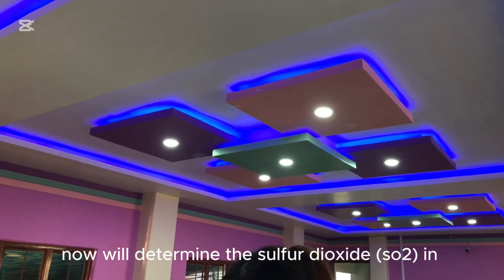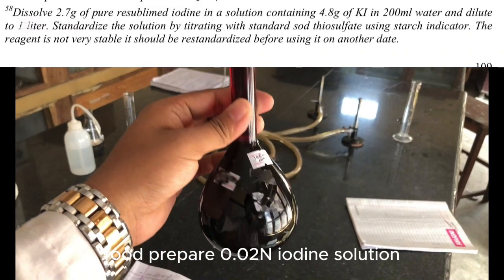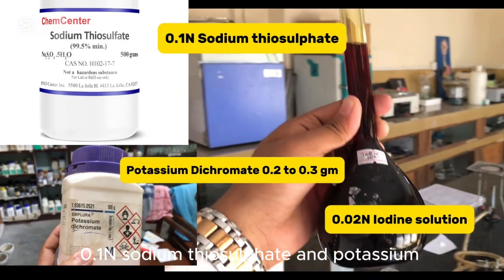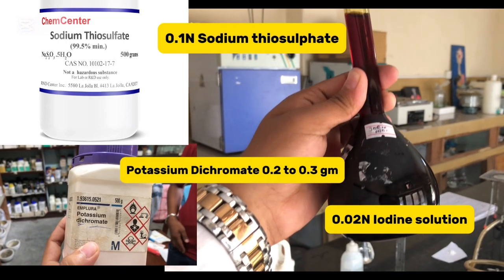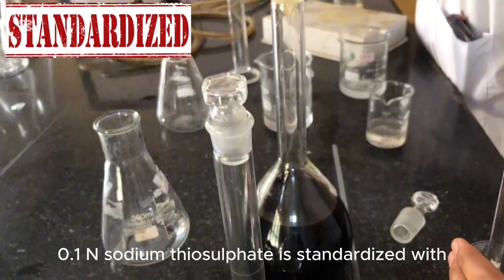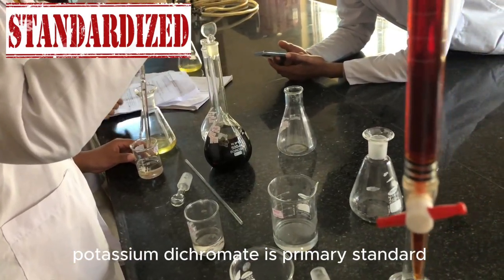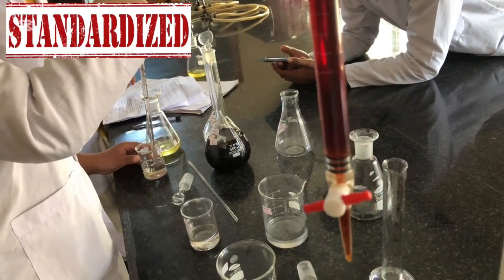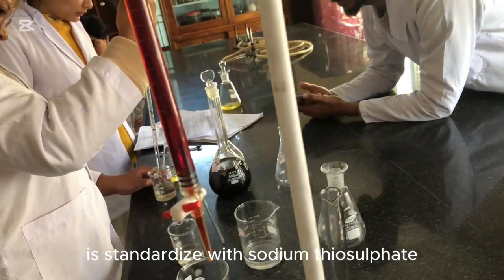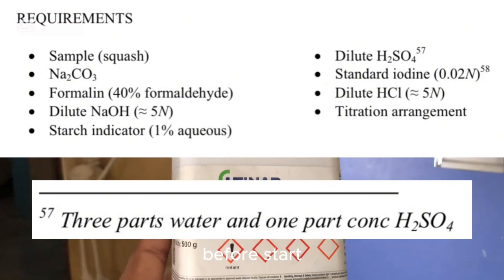To determine sulfur dioxide in food, first prepare 0.02N iodine solution, 0.1N sodium thiosulfate, and potassium dichromate. The 0.1N sodium thiosulfate is standardized with potassium dichromate as a primary standard solution. After that, the 0.02N iodine solution is standardized with sodium thiosulfate. After standardization, prepare all chemicals before starting.